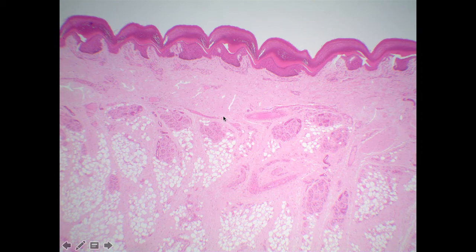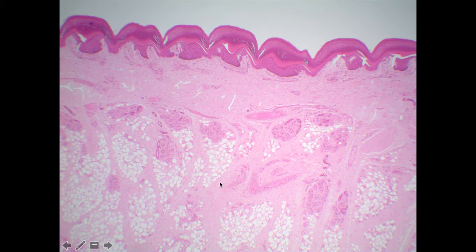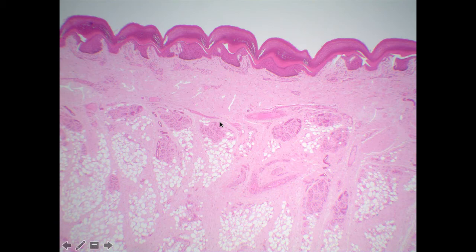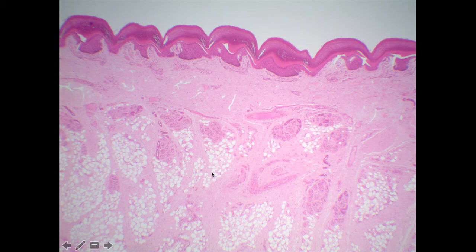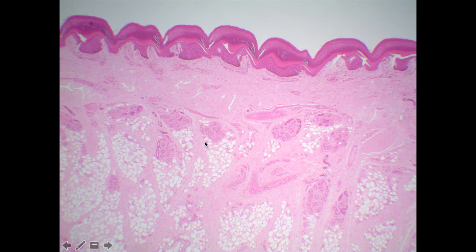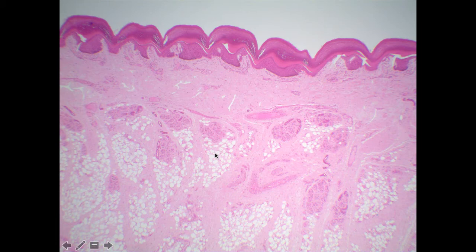There is another region down here which is technically not part of the skin, but is often taught along with it — and this is the hypodermis. The hypodermis is typically composed of loose areolar connective tissue, or in this field of view, a lot of adipose tissue. We used a skin slide as an example of adipose tissue, and you're hopefully going to find some down in this area.